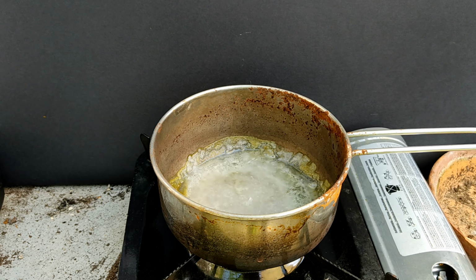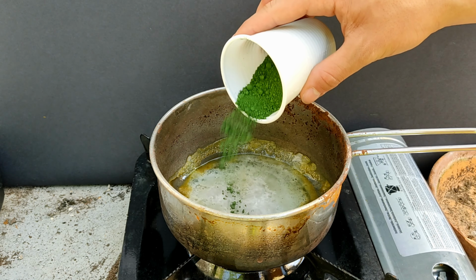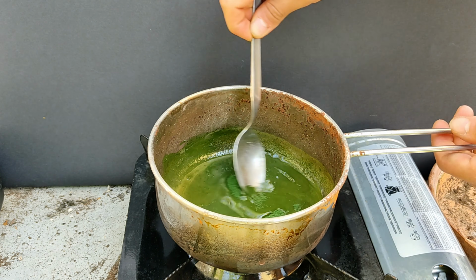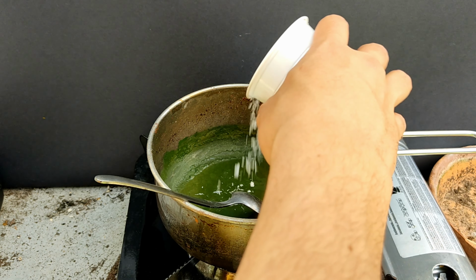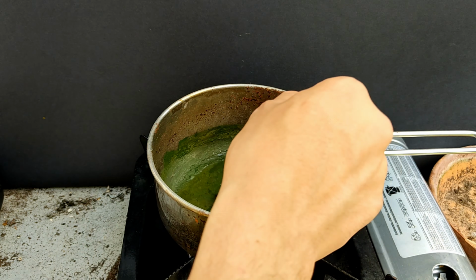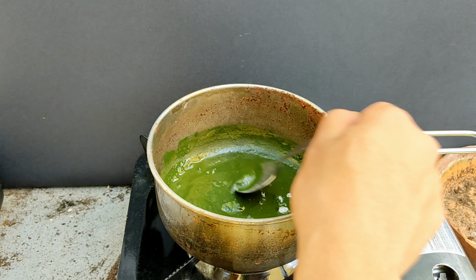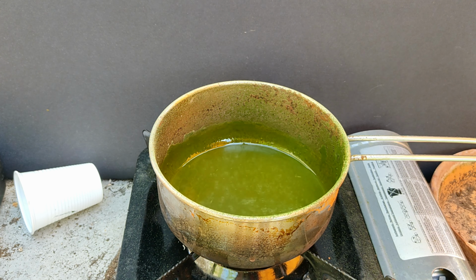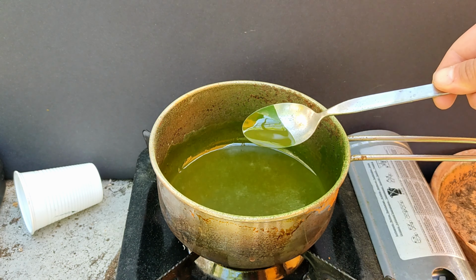When the hydroxide melts into a uniform liquid, we'll start adding the chromium oxide, then stirring it into a homogeneous mixture. As the slurry gets uniform, we start adding the oxidizer, potassium nitrate, in portions. The mixture will eventually start changing color from green to dark yellow, and it will bubble because of the release of hot steam produced during the reaction.